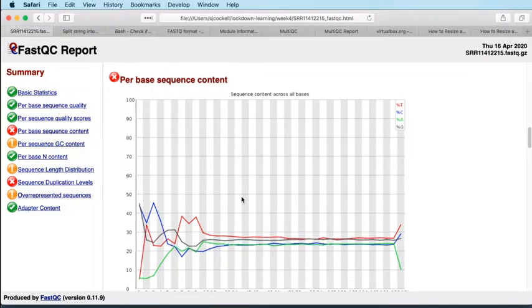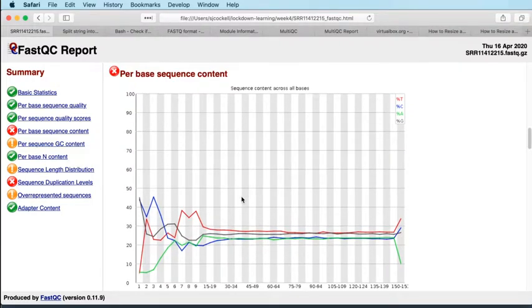Okay, so on to our first cross, and that is the per base sequence content. So this is again looking at positions in reads, so looking at position 1 in every single read in the experiment, and figuring out the balance of the different bases at that position. So the balance of A's, T's, C's, and G's at that position. And what you find is, let's start with what FastQC expects. What FastQC expects to find for this particular report is parallel lines, so that the quantity of A's, T's, C's, and G's doesn't vary across the read.